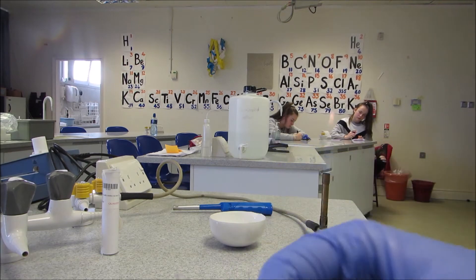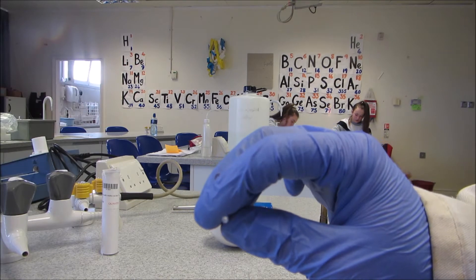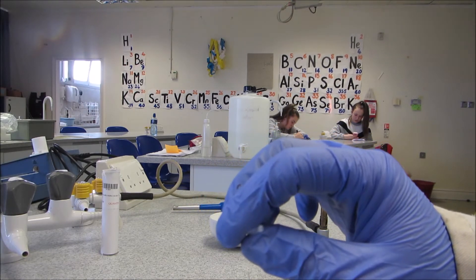So if I show you that now, you can see that it's now sealed at the bottom. So you're going to need at least two of these to then put your aspirin inside to determine melting point.